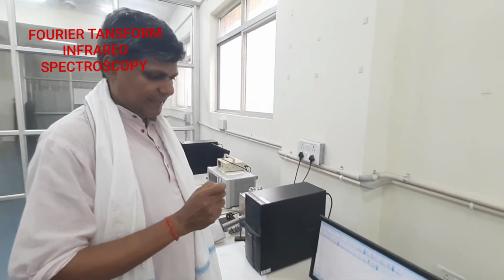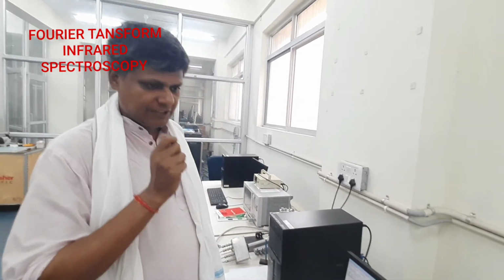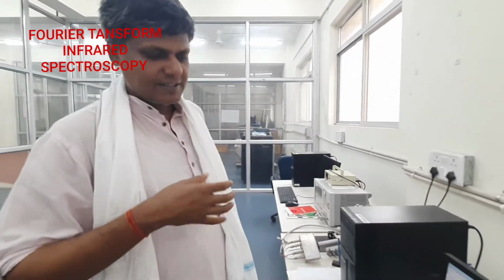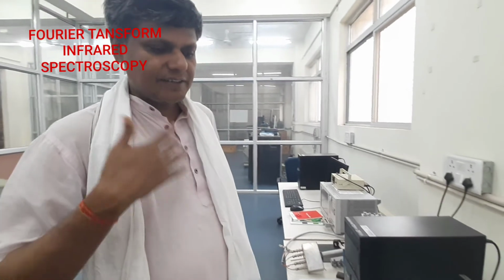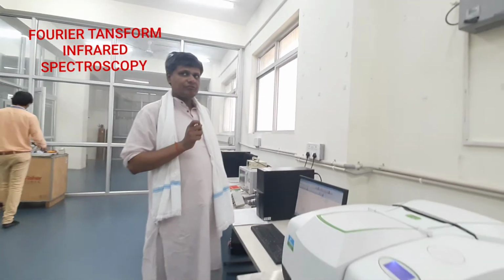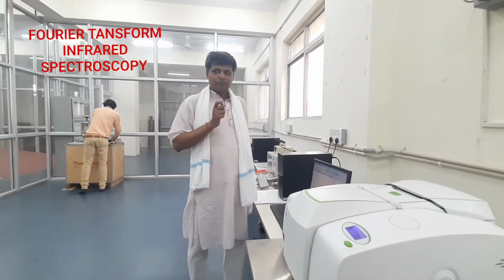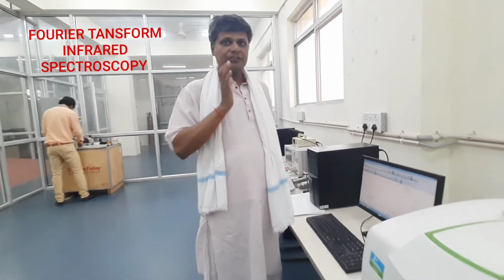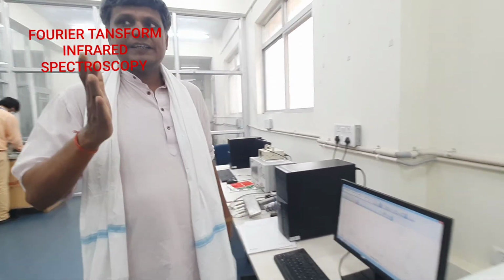Now on the basis of this result we can say this material has certain functional groups, maybe the chloride of a material, the oxides of a material, the nitrate of the material. Thus, in this way, this equipment is very useful to find out the important functional groups and the chemical bonding in the material.